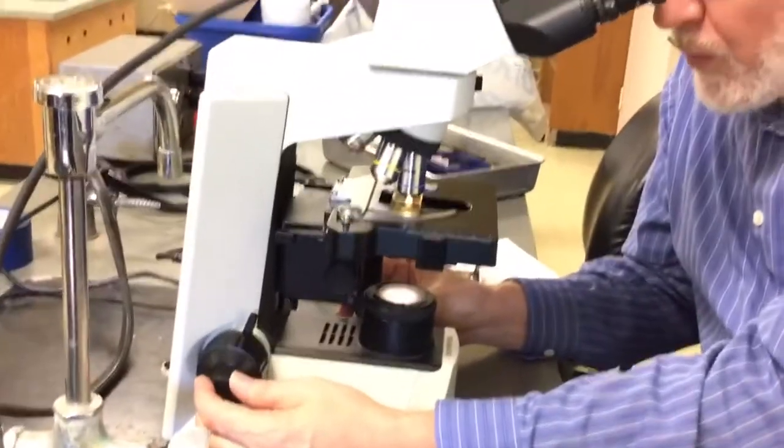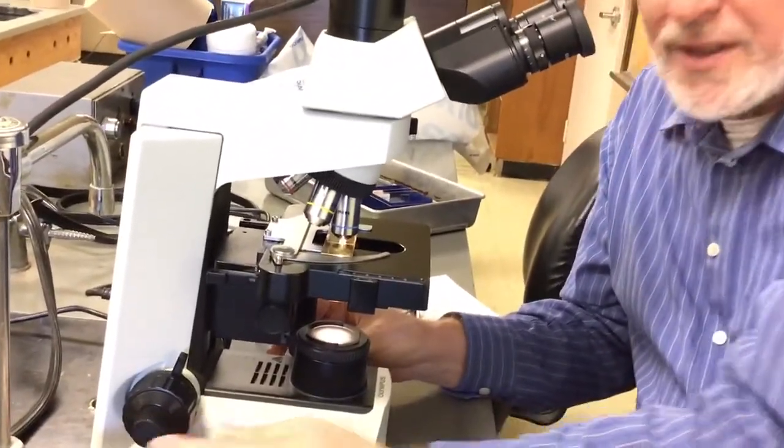There's no way in the world I can get this thread in focus. And if you look, even the teeny tiny threads off to the side, this is in focus, but as soon as it curves away a little bit, it's out of focus. This one is out of focus until it curves into that narrow plane that's in focus.